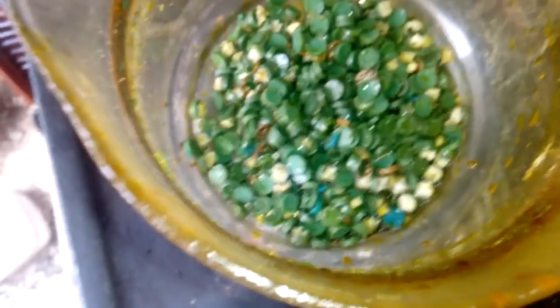Finally we came to the end. Look what is left — but we still got some gold here, and here. You see that? So we need to do one more batch.